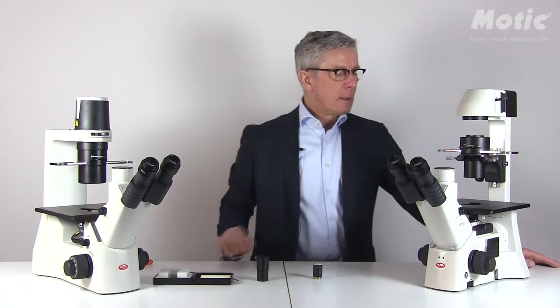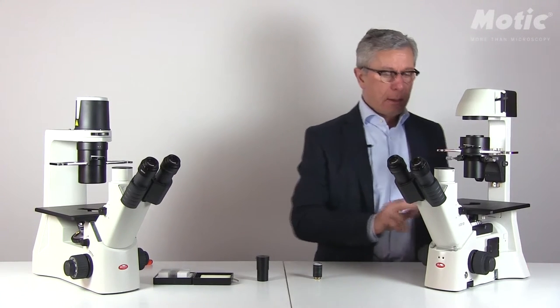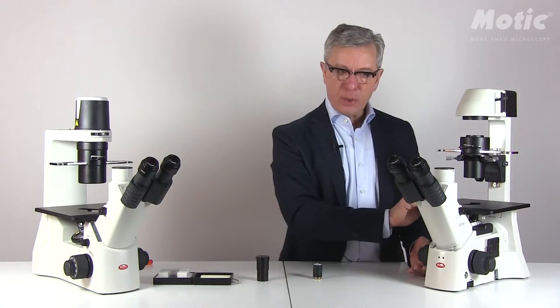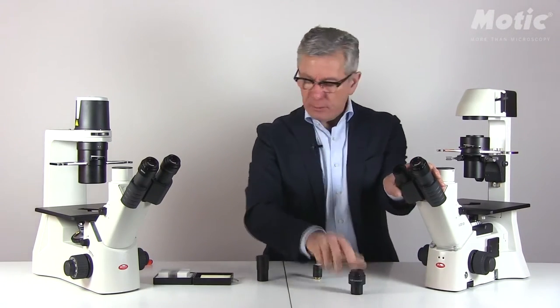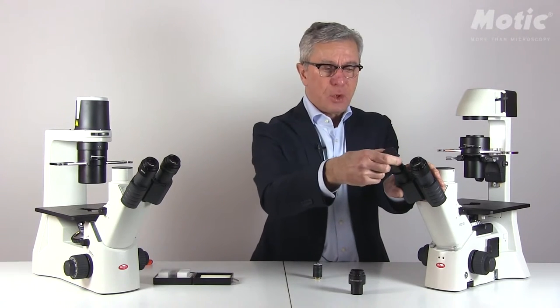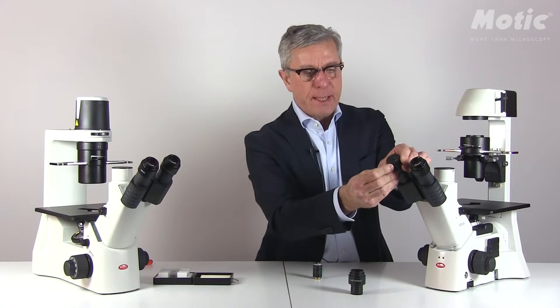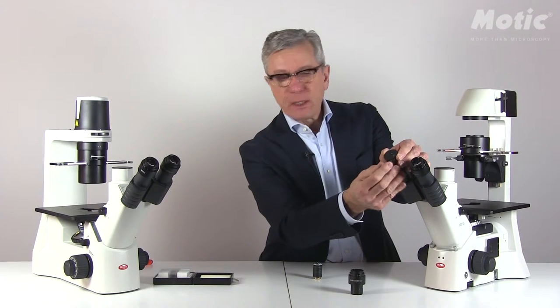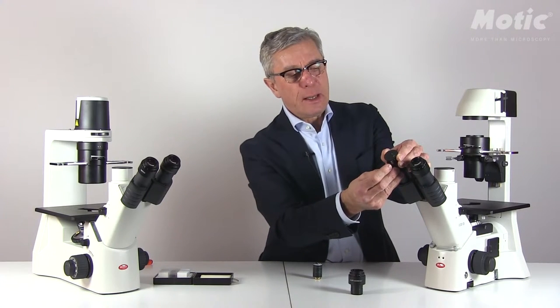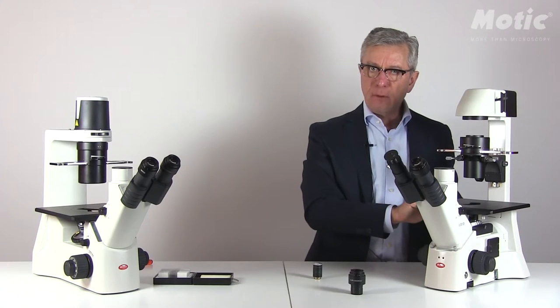Now we can start with the phase contrast setup. Once the bright field setup has been done, make sure that you have a phase contrast objective in the ray path and the sample in focus. Now please remove one of those eyepieces and replace it by the so-called centering telescope, which is an integral part of the standard packages. Loosen the screw, pull out the inner optical part of the centering telescope and try to find the so-called back focal plane of the objective.